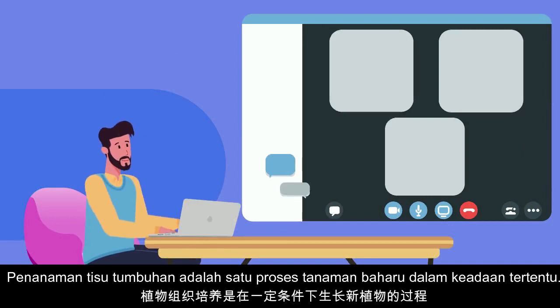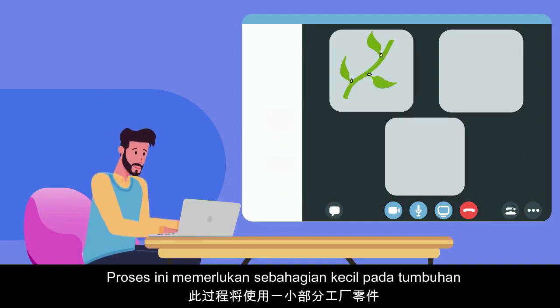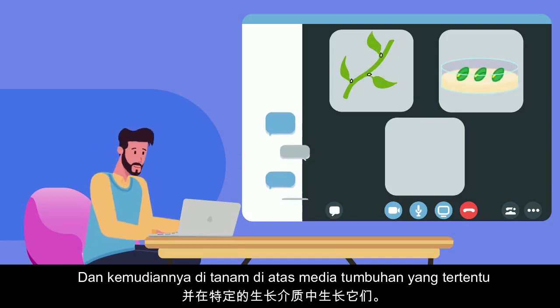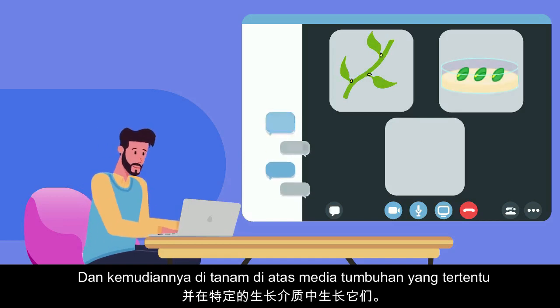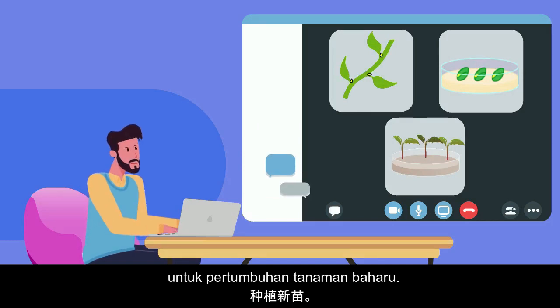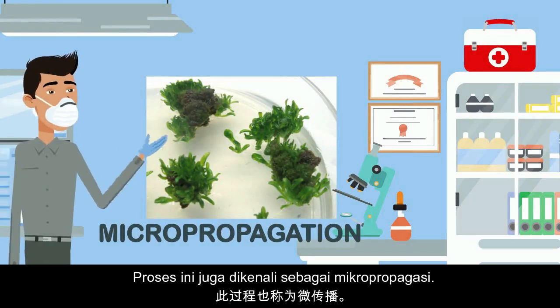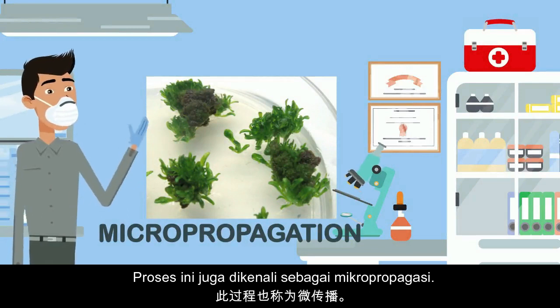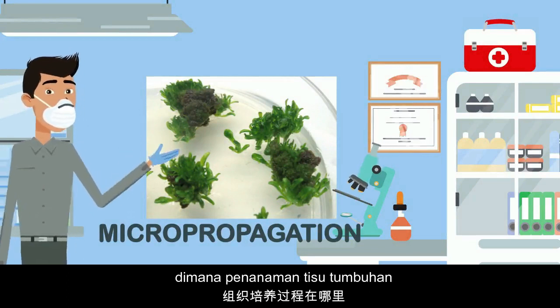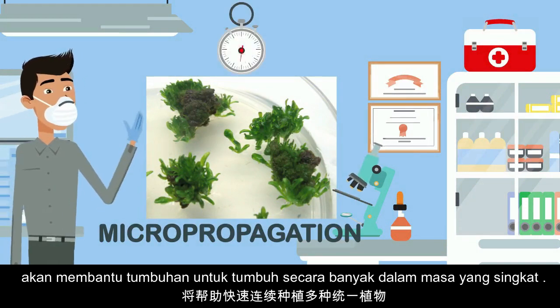Plant tissue culture is a process to grow a new plant under specific conditions. This process uses a small piece of plant parts and grows them in a specific growing medium responsible for growing new plantlets. This process is also known as micropropagation, where the tissue culture process helps grow multiple uniform plants in quick succession.